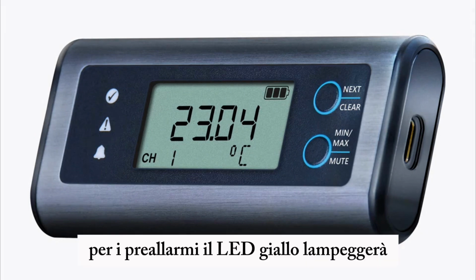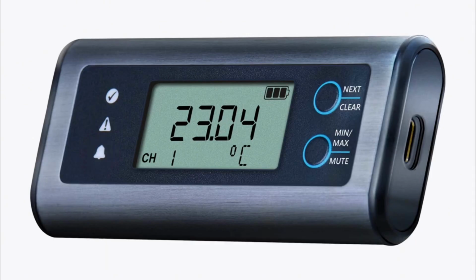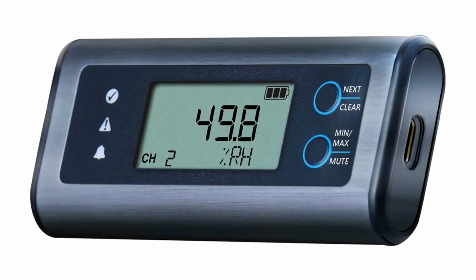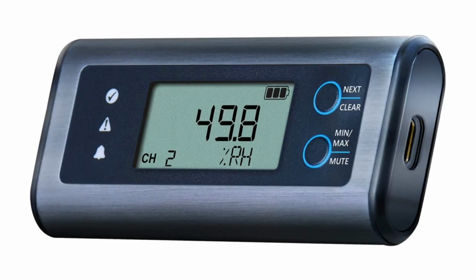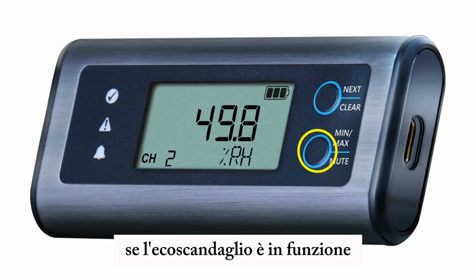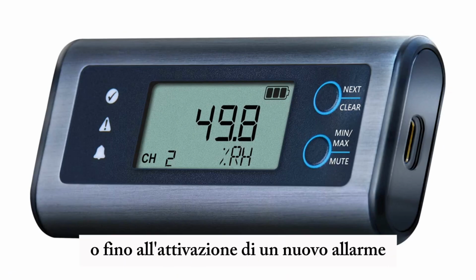For pre-alarms, the yellow LED will flash, but if a full alarm triggers, and that includes a cumulative alarm, then it's the red LED instead. If the sounder is enabled, this will also start beeping. If the sounder is in operation, a long press of the bottom button from any of the channel screens mutes the sounder for 15 minutes, or until a new alarm is activated.